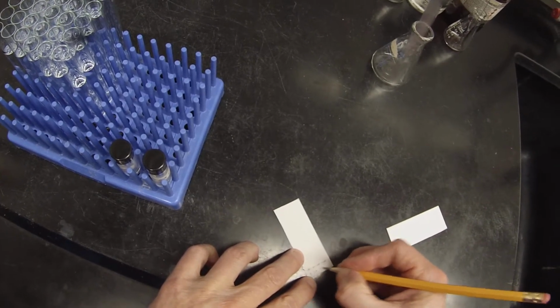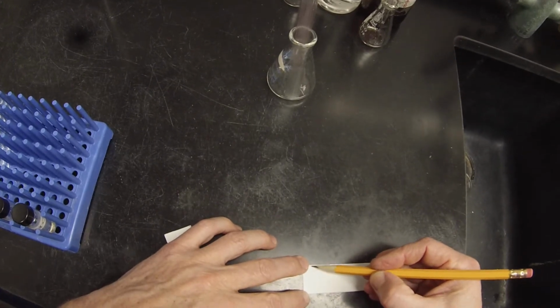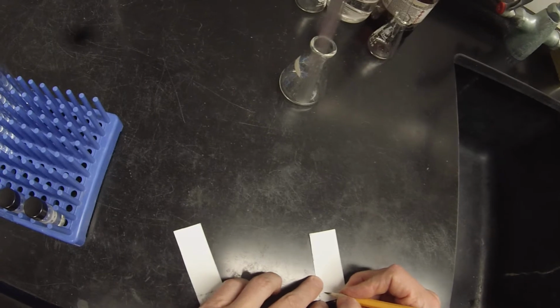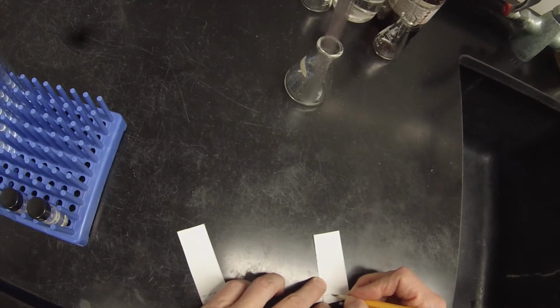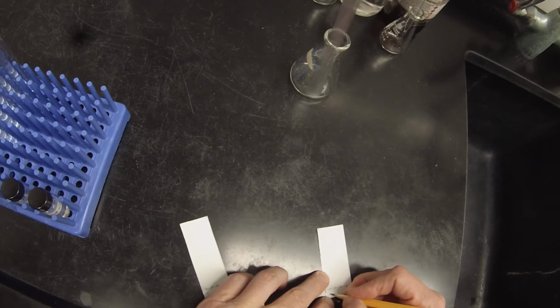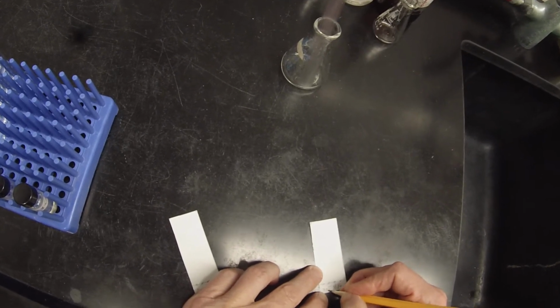There's 9, 10, 11, and 12. And 14, 15, 16, and 17.